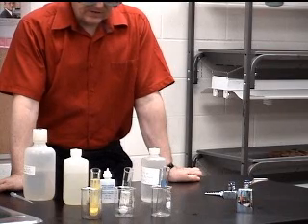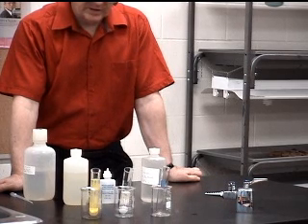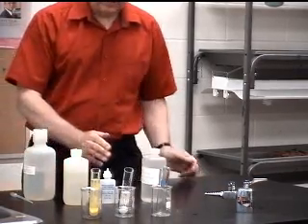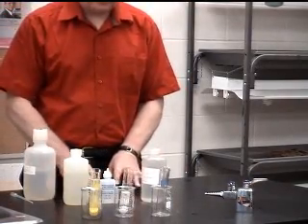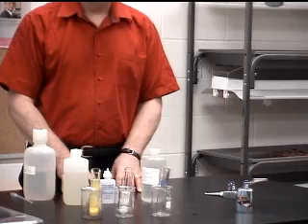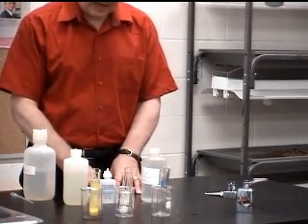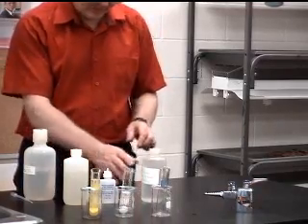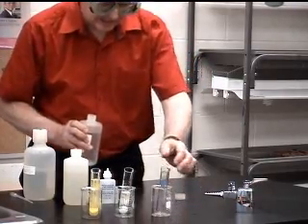This is a little demonstration called Is All the Lead Out? And again it deals with solubility equilibria. One of the things is that different slightly soluble materials have different KSPs. Those KSPs indicate the relative solubilities of everything, and this again has environmental implications. One of the things that we're going to look at is the lead.